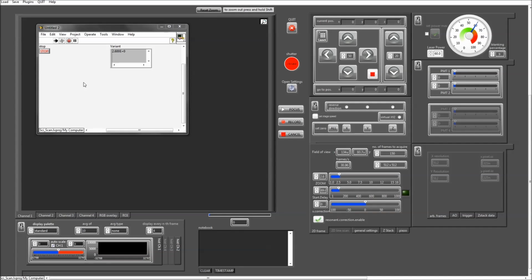Despite me not having changed anything inside SciScan, I've only written another standalone LabVIEW VI that listens for these events. Now, I hope that this demonstrates a little bit how easy it is to interface standalone VIs with whatever is going on in SciScan, and that should help you to integrate any other workflow software that you have or that you're planning to write that will help you to automate your experiments.